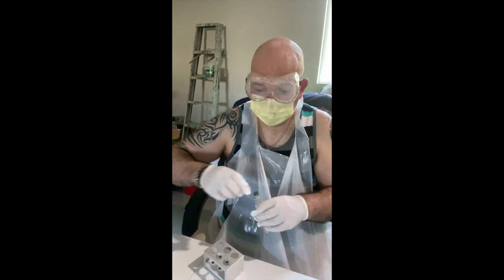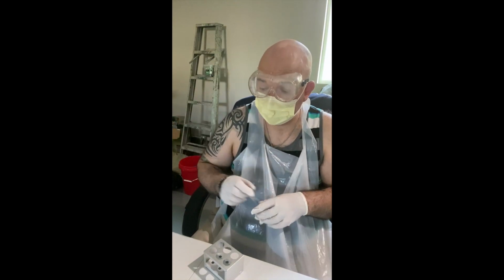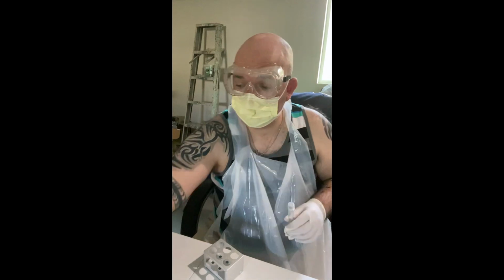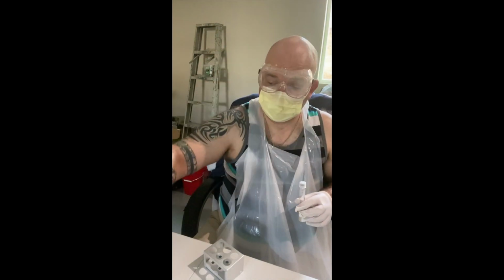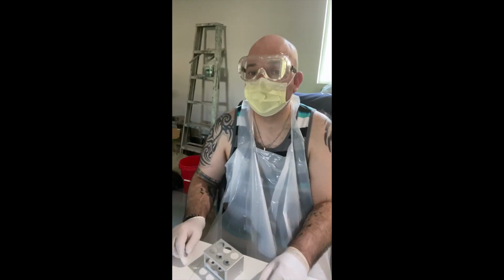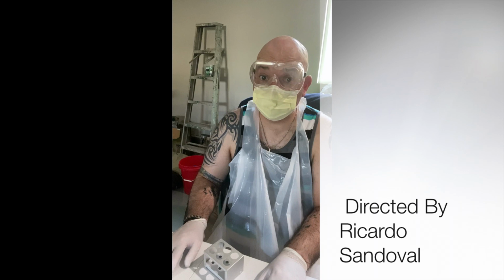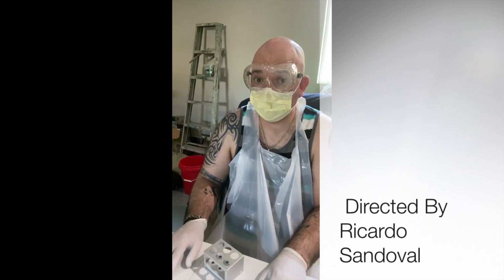Okay, so this is the conclusion of the experiment video for Lab 8. These phenol red cultures are now going to sit in my incubation location, which is the dark temperature controlled closet of my home office for 12 hours. And then we'll reconvene from there.